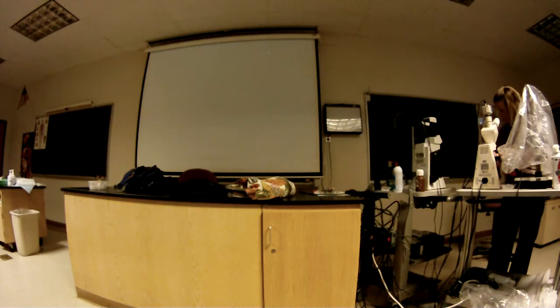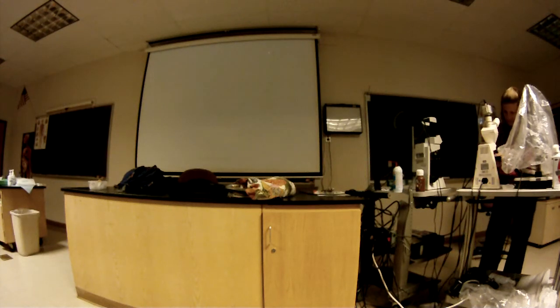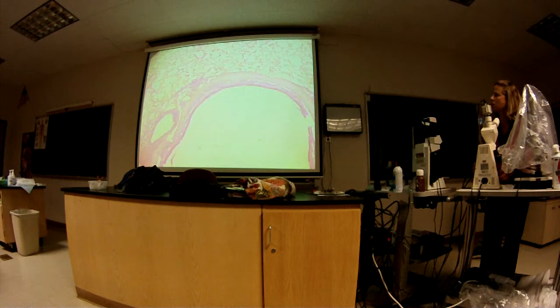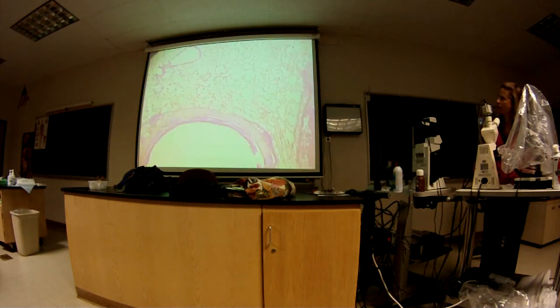I was looking for that lymphoid nodule, but now I can't find it. Come back to that another time. Can't quite get it into focus. Pretty close though. Okay, so here we are.